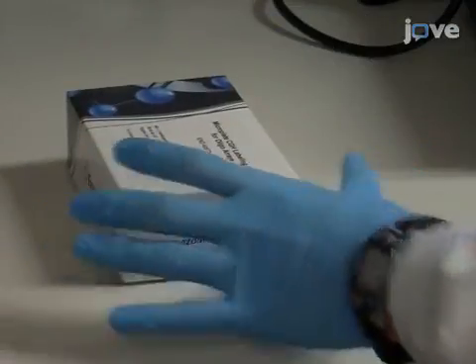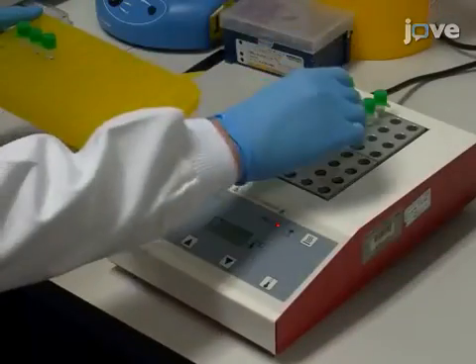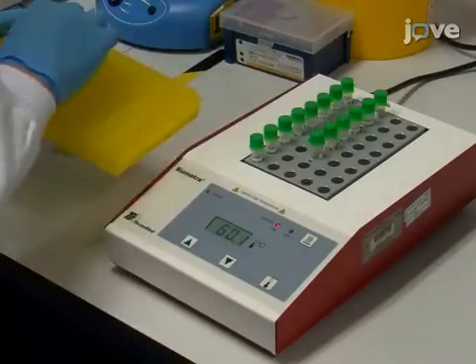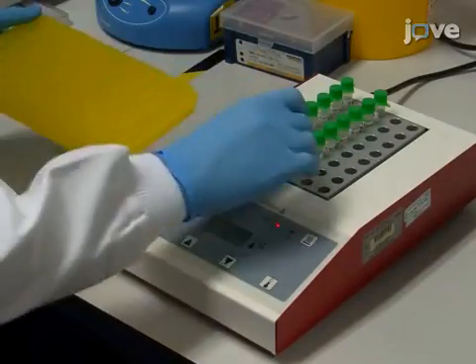Once thawed, equilibrate the covered plate for another 30 minutes at room temperature. Equilibrate the DNA samples for 15 minutes at 60 degrees Celsius at this time as well.